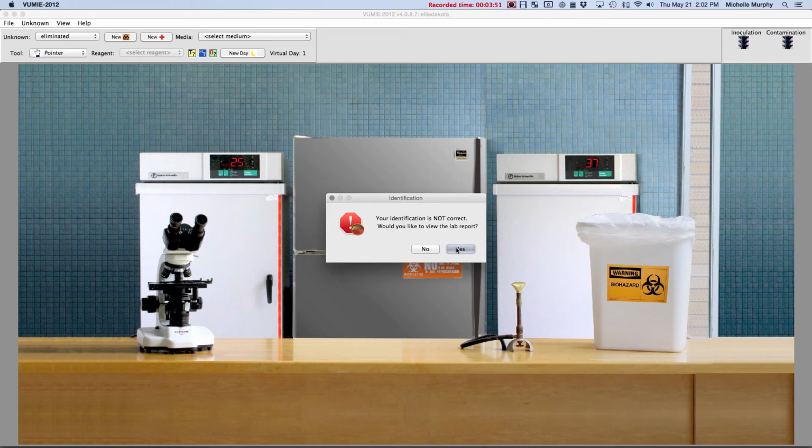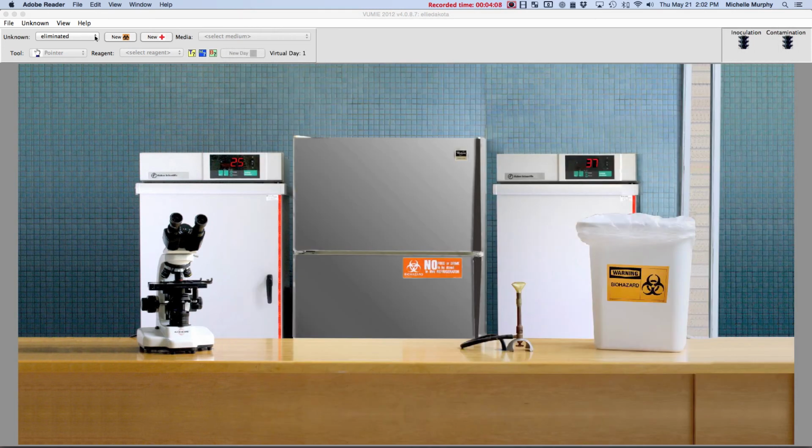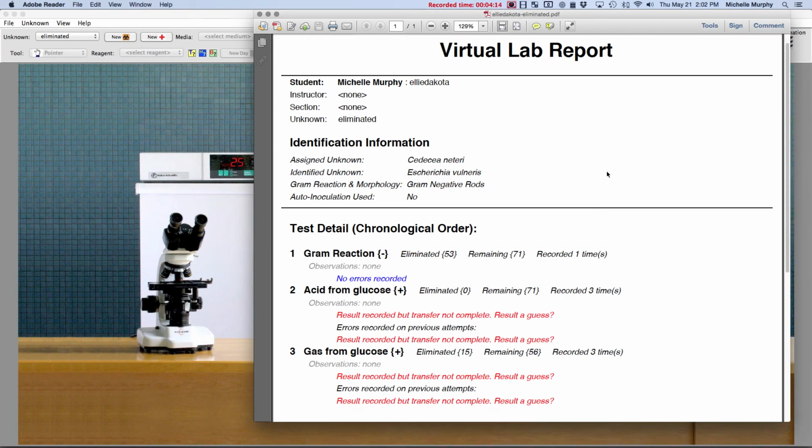I'm done testing. I was not correct because I was just guessing, but I do want to see my report. Oh, that's a good thing that happened. I didn't close my lab report last time. I just went back to identify, so it's still showing me the old one. If I close my lab report, view my lab report again, that'll update it. That was a good thing that happened so that I could see that because sometimes that confuses people.